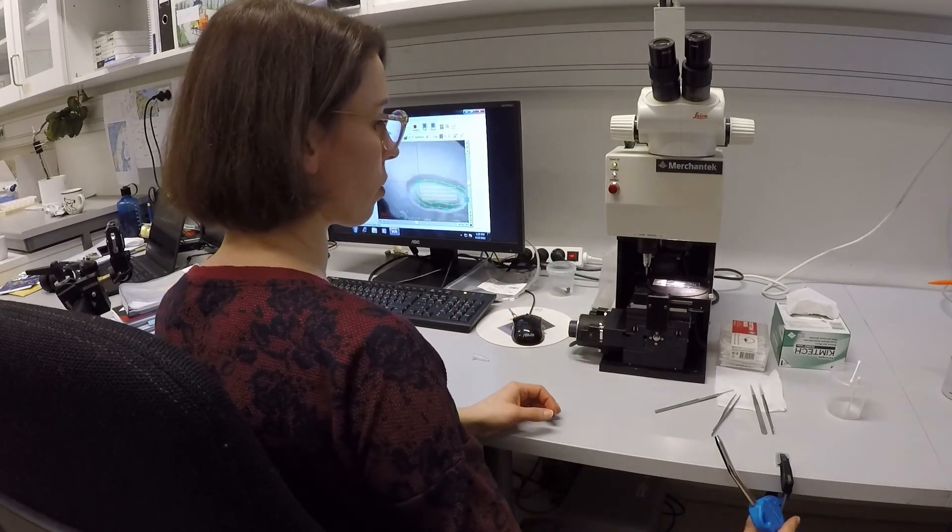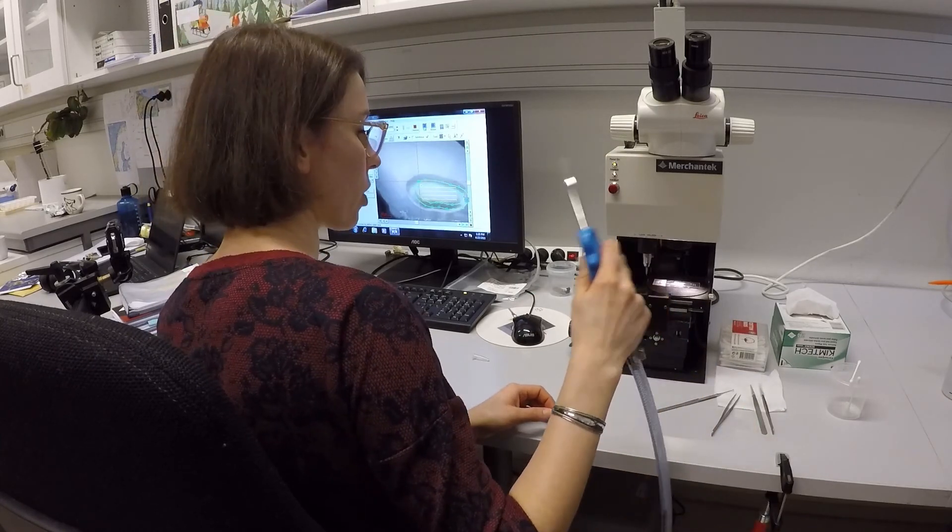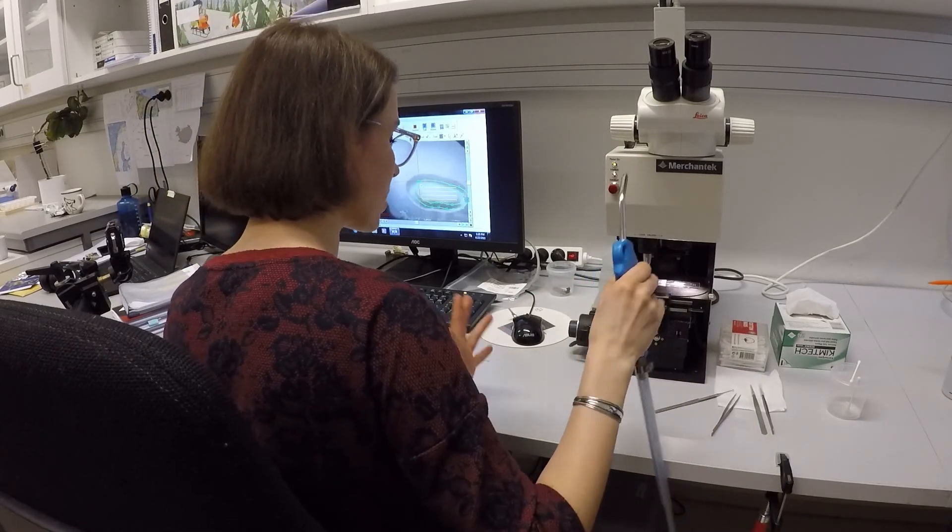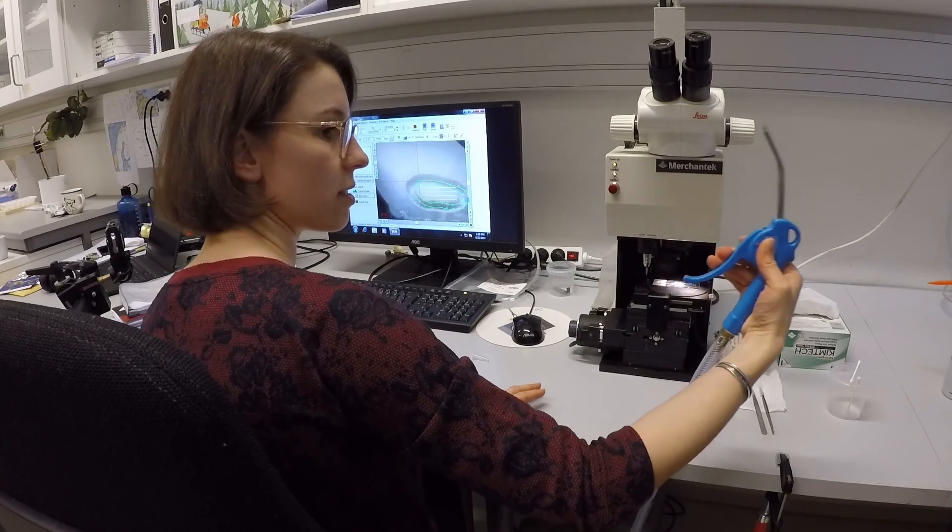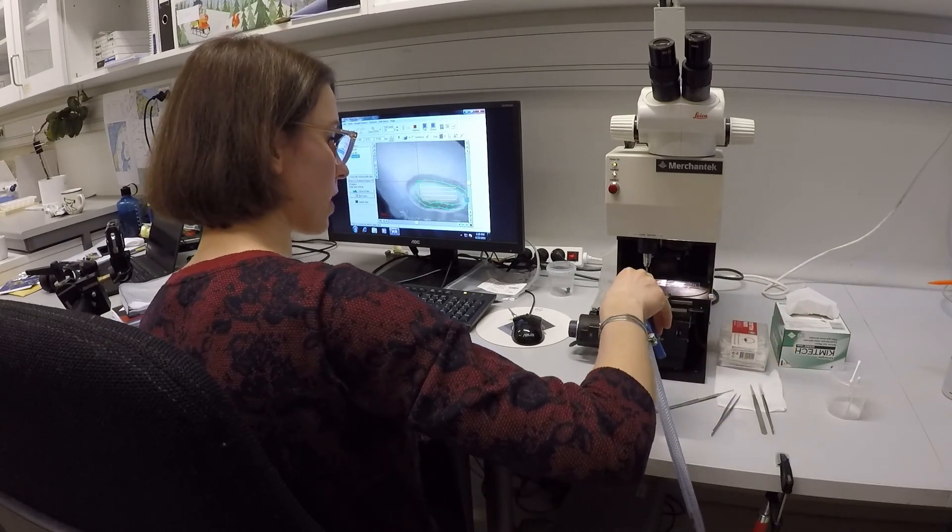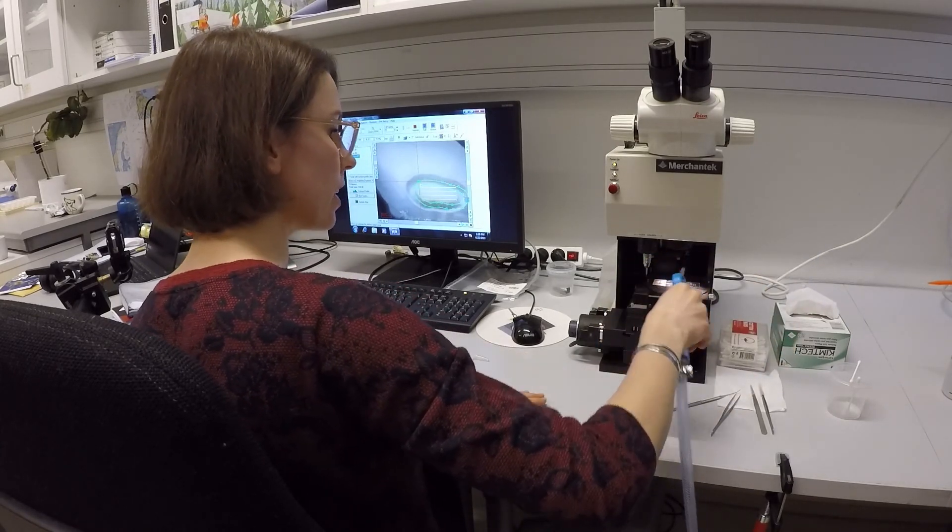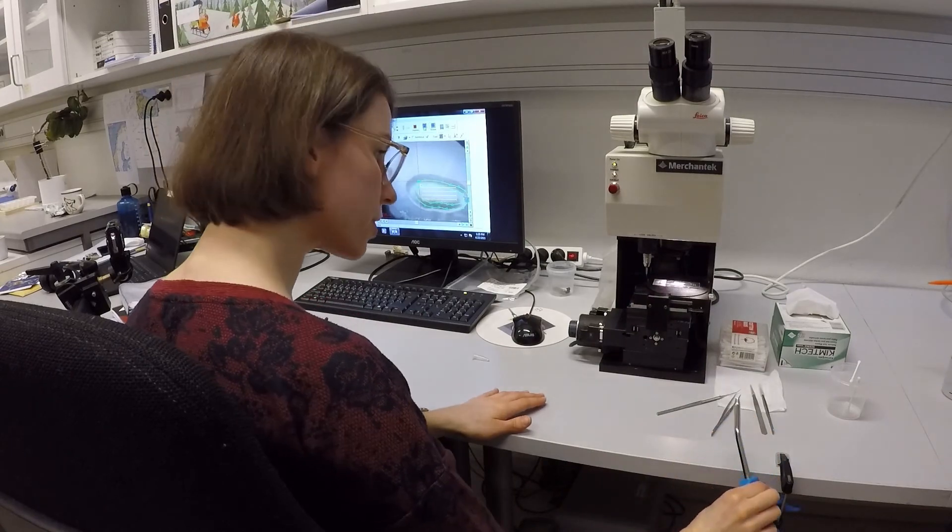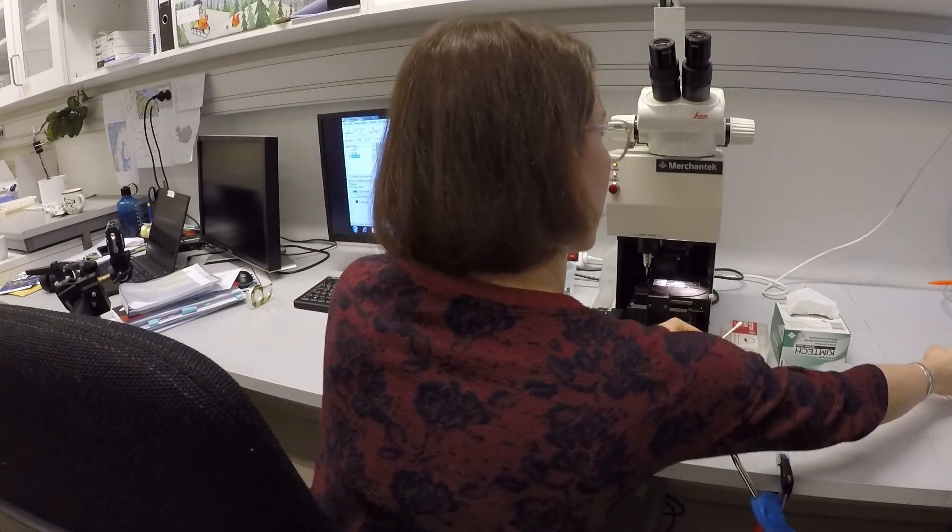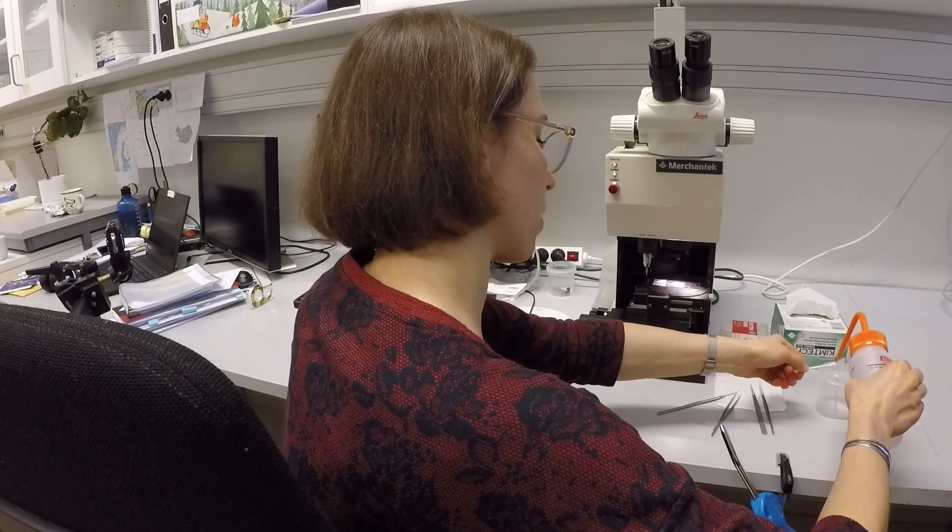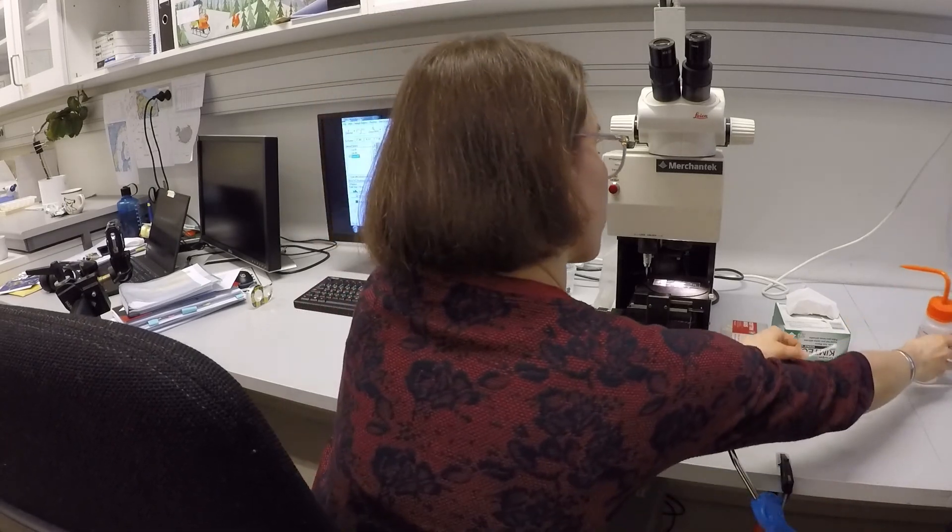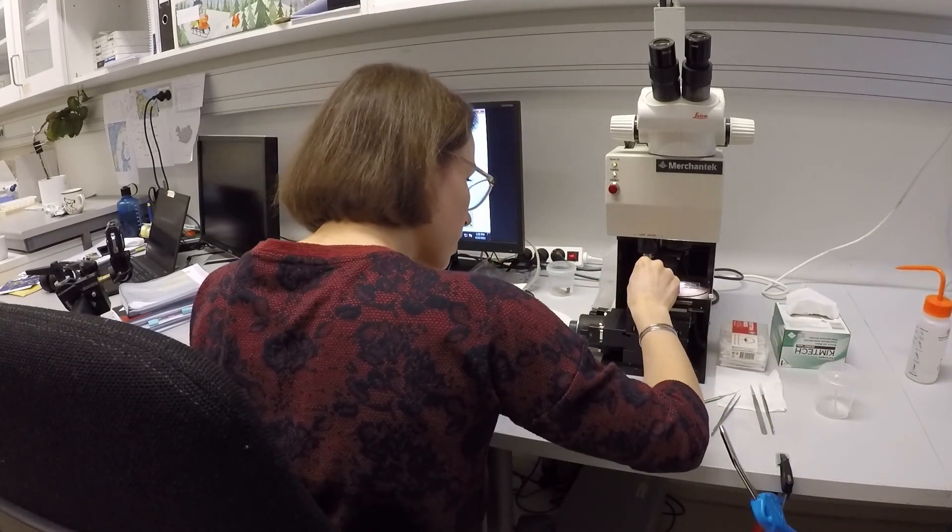Which includes, so first of all, just to get rid of like the more coarse material, I use this gun with the compressed air and just clean it, also the drill bit, which is very important. Then I use my cotton bud again with some ethanol to clean the drill bit.